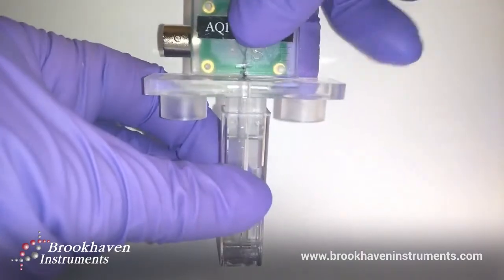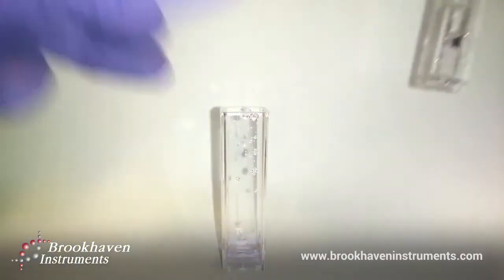Pulling the cuvette off will leave you with your original sample, should you want to keep it.